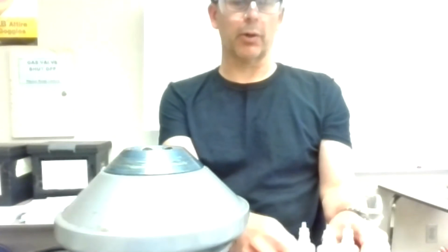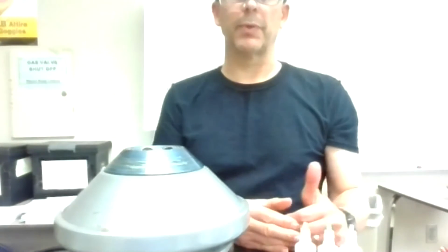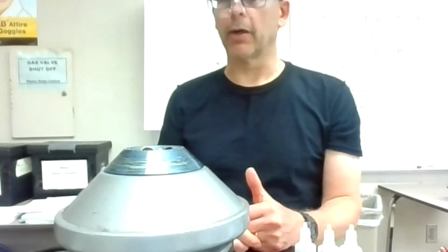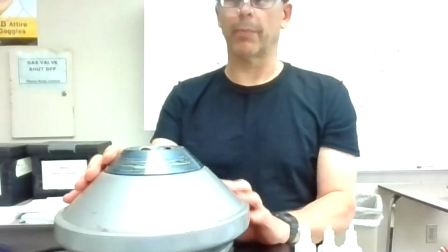Follow your flow chart and make sure to be careful with the flow chart order and the ion order on page 5 or 6 of your homework packet. Make sure you're doing the right thing there. Any general questions about it, watch the general information video about unknowns, or let me know if you have questions.